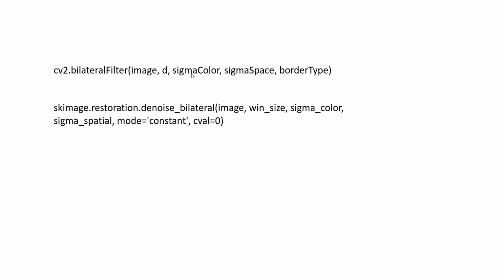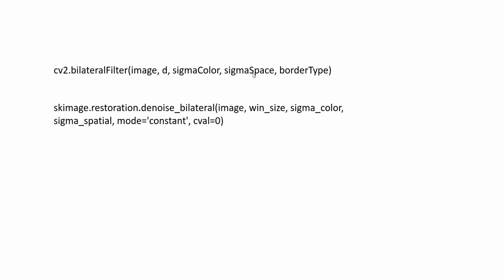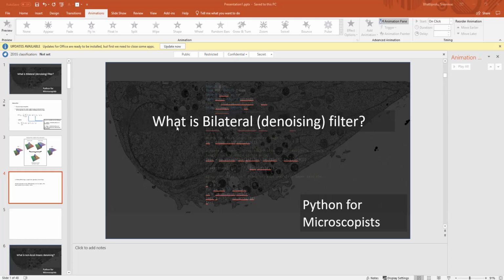The next one is the sigma color and sigma space. These are nothing but these two, sigma S and sigma R. Okay, and finally, the border type. The border type is, again, how do you want to deal with the edge pixels? Okay, in this case, I'm adding a constant value with a value of 0. Okay, so let's jump into the code.